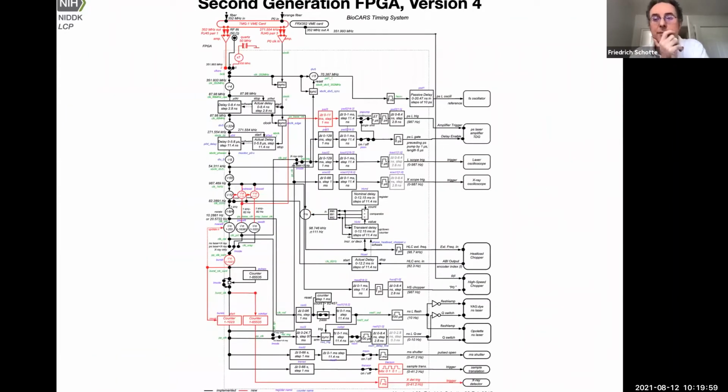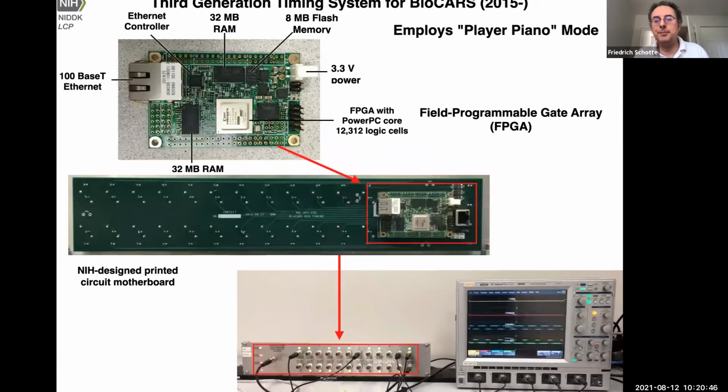One of the things that was a bit of a nuisance with the second generation FPGA is that every time you wanted to add something new, you basically had to redesign it, adding new components here marked in red. You want to change something, a new counter. You want to change something, a new pulse generator, a new delay generator. So it's a tedious process because the whole design needs to be recompiled, which is not fast. It takes like 20 minutes, but it's always trial and error. You have to add bit by bit and check that it actually works. And you're just duplicating existing functionality for something that is very similar, but needs some extra trigger because of some extra piece of equipment. So this is why we came up with this third generation FPGA.